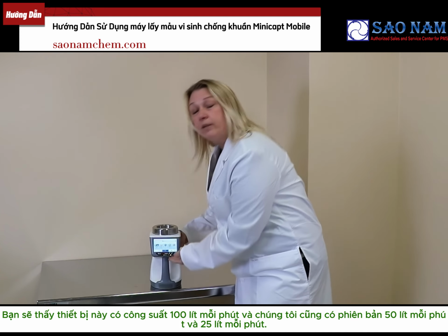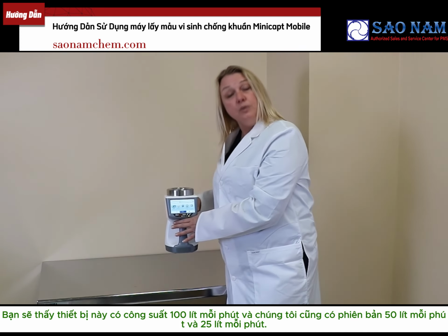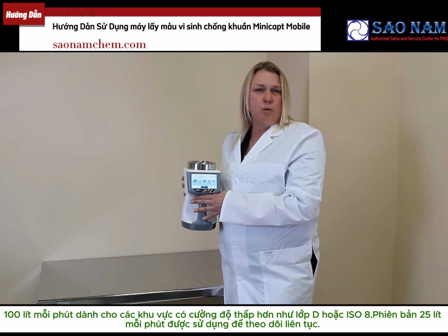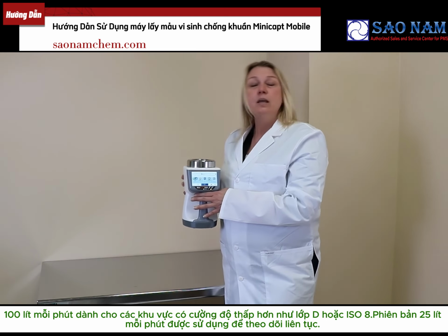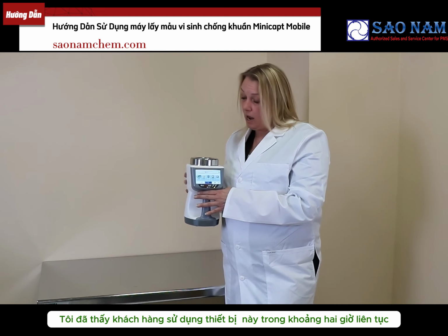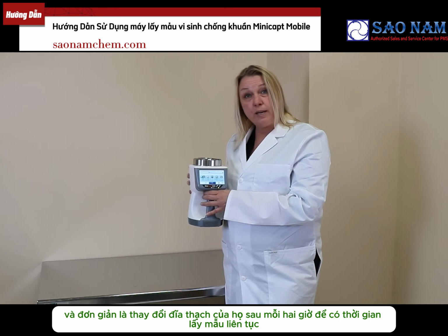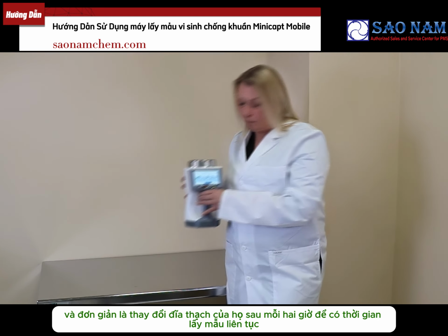You'll see the instrument is 100 liters per minute. We also have a 50 liter per minute and a 25 liter per minute unit. The 100 liter per minute is meant to take a 10-minute sample. This is for lower grade areas like a grade D or an ISO 8. The 25 liter per minute unit is for continuous monitoring. I've seen customers use the instrument for up to 2 hours, and they simply change out their agar plate every 2 hours for a continuous amount of time of the fill.